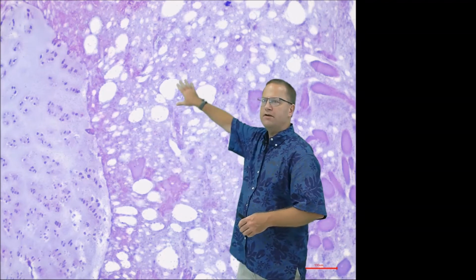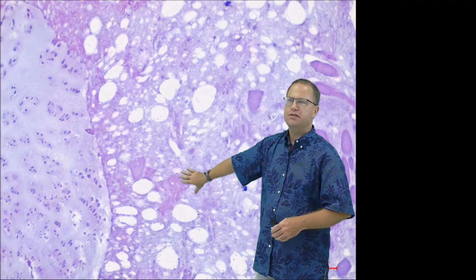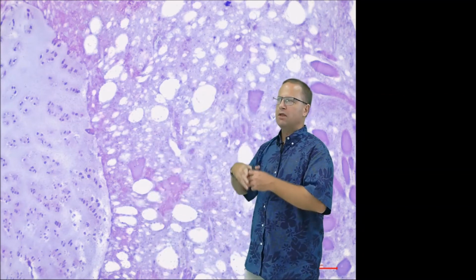All these big white droplets in there, those are all triglyceride resulting from adipose tissue. And then over on this side, we have some skeletal muscle fibers, so that's skeletal muscle. And everything else pretty much that we can see in there is that kind of ground substance material that was created when we took all those proteins and chopped up muscle fibers and cooked them together at high temperature to give us this sort of artificial ground substance. And so that's what we're going to call it.